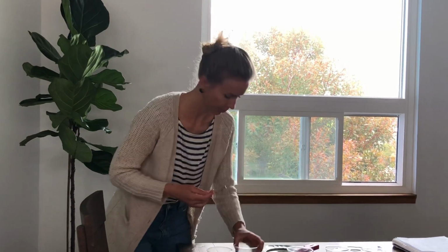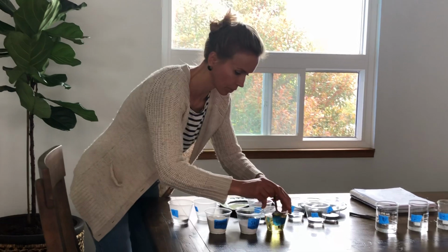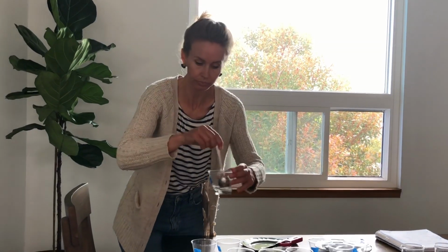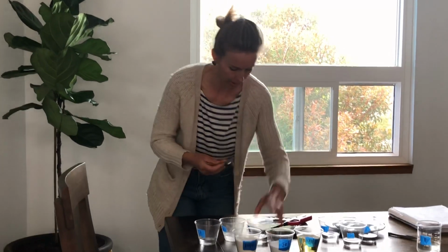Is soluble. Oil now, same amount, in liquid 1, not soluble. So you're writing down all of this data.